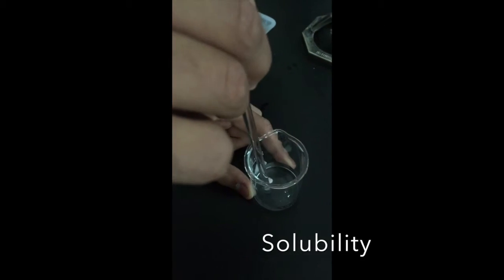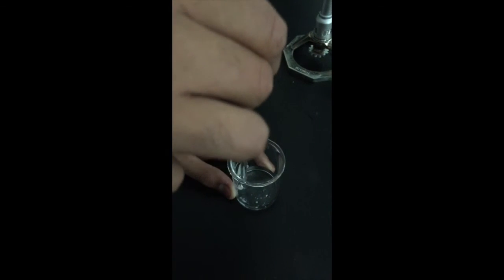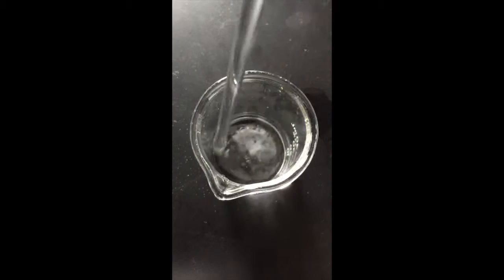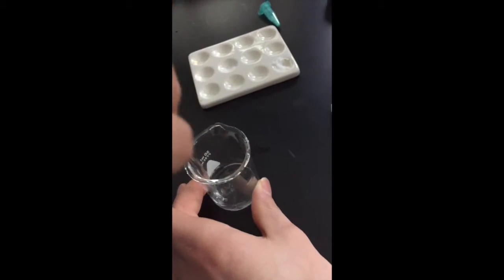Finally, a solubility test was conducted. In the solubility test, 2 beakers, each full of 10 milliliters of distilled water, were used. First, a small spoon of each substance was taken and put into the beaker. And we then tried to mix that substance in the beaker to see if it would dissolve. From this experiment, we noticed that some of substance number 20 dissolved after the big chunks of the particle were crushed into smaller particles, and substance 21 dissolved a lot easier and a lot quicker, and the particles rested at the bottom of the beaker.